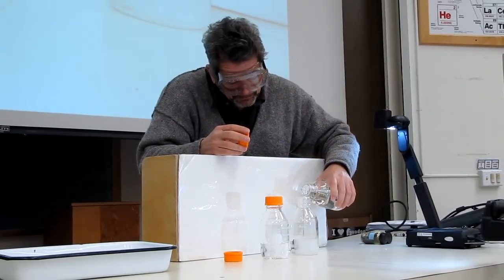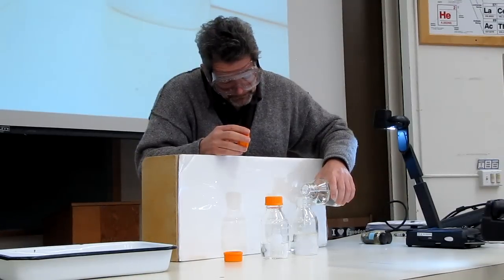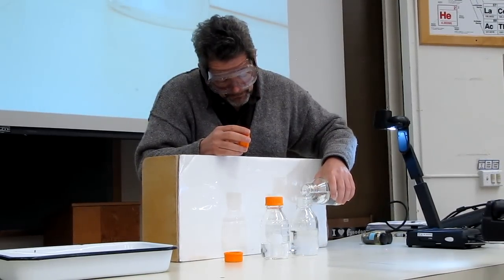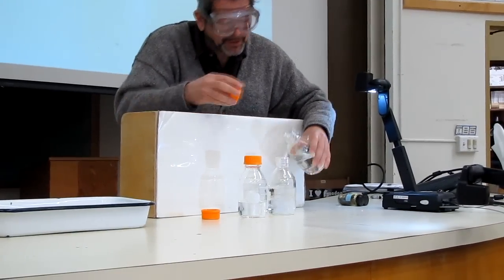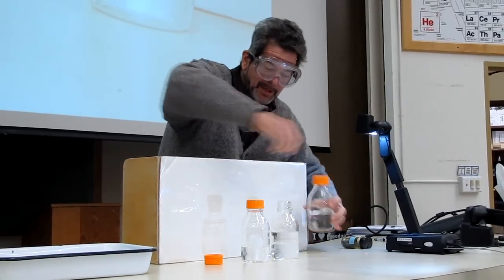Water into hexane. What do you see? They're not mixing. They're not mixing. The water is pouring through the hexane to the bottom, which tells me the water is denser. Water is pretty dense stuff. You might expect that.